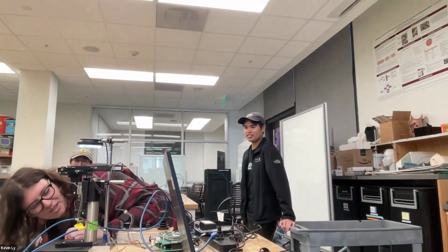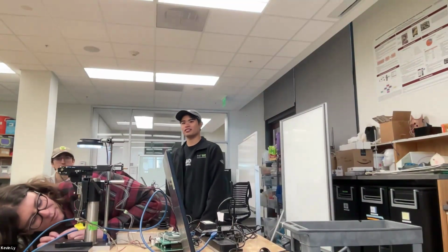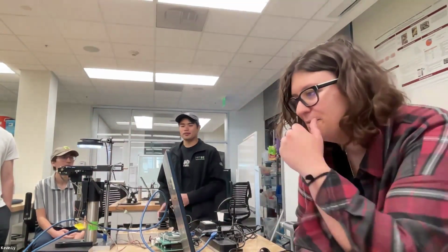Right now, in order for the software to run, you need to make sure that the camera is put into the config file. I think that's where the error is coming from, so I'm making sure the info from the camera is correct in the config file.